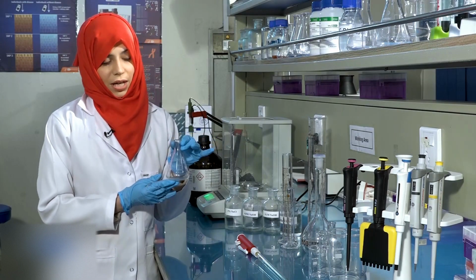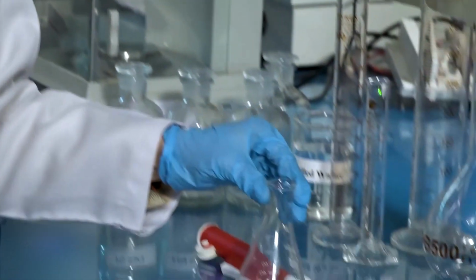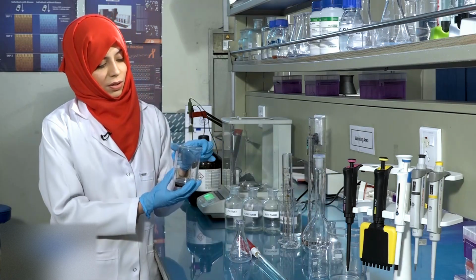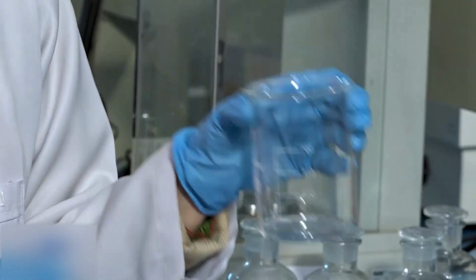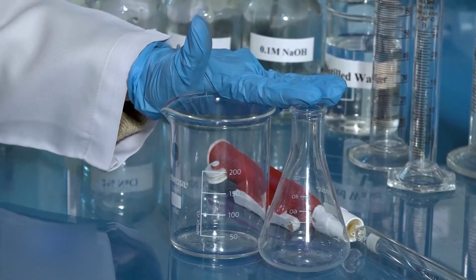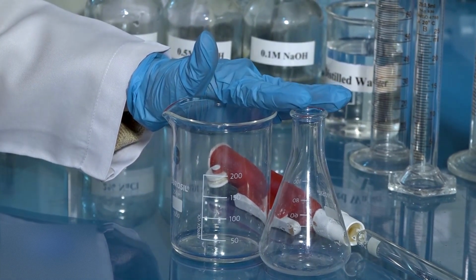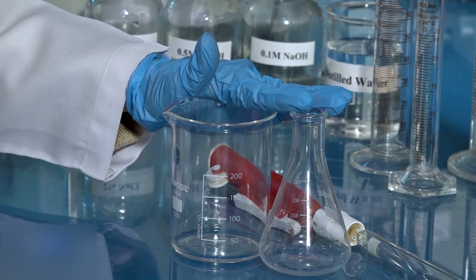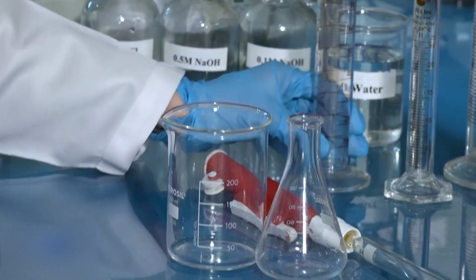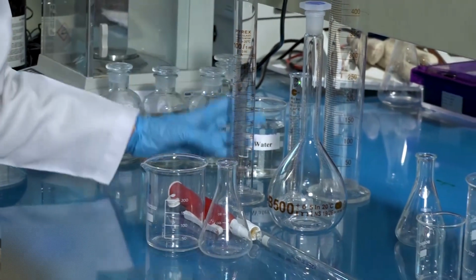This is a conical flask, and like other glassware, this also comes in varying sizes of different capacities. This is a beaker and is also available in different capacities. Remember that beakers and flasks may be used while preparing solutions but are never used to define the total volume or the final volume of the solution. Whenever preparing solutions, always raise the final volume in a narrow-necked glassware, such as a volumetric flask or a measuring cylinder.